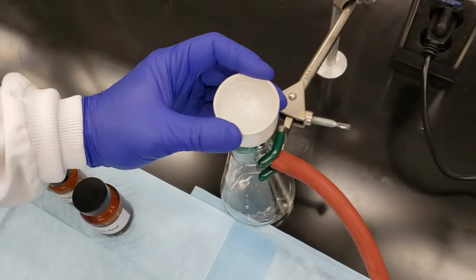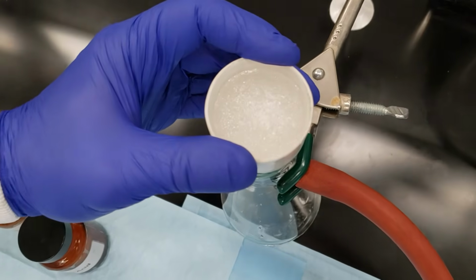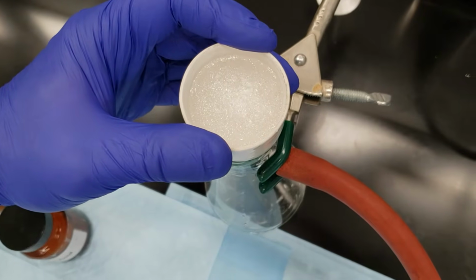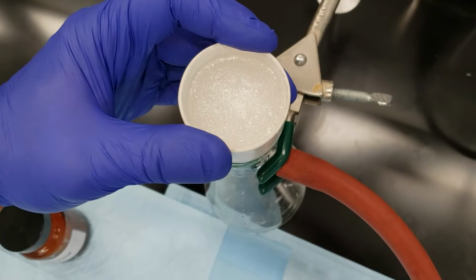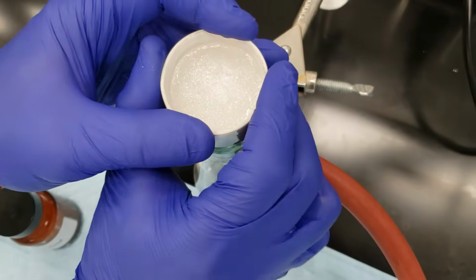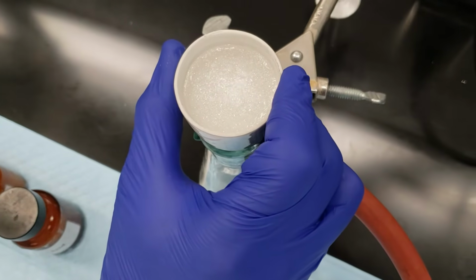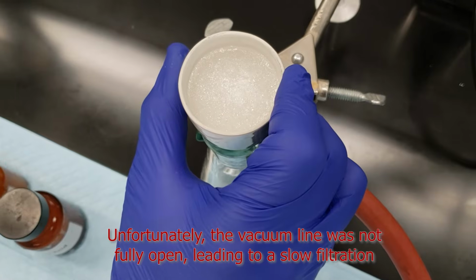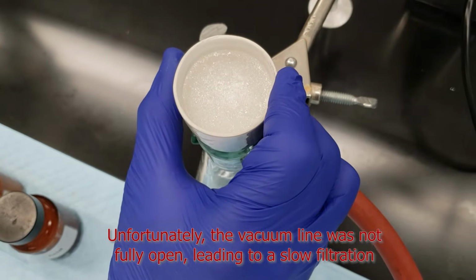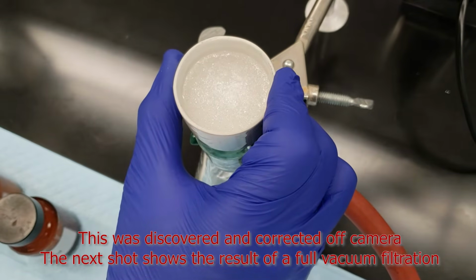Okay, I'm pushing down, I'm exerting a little bit of pressure, and we're letting the vacuum pull our liquid through our filter paper. This can sometimes take a little bit of time, but in the end we'll have our isolated crystals trapped on the filter paper, and our liquid, our water, will go through to the catch flask. We'll let this pull for a little bit and check back in a minute.